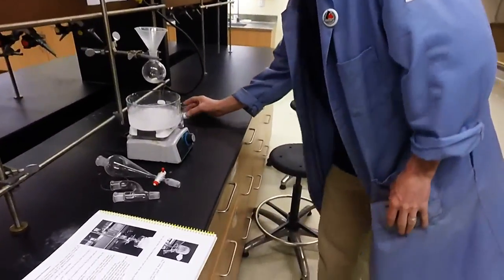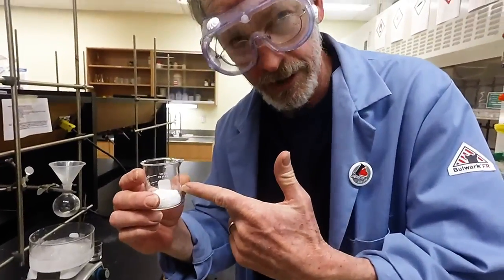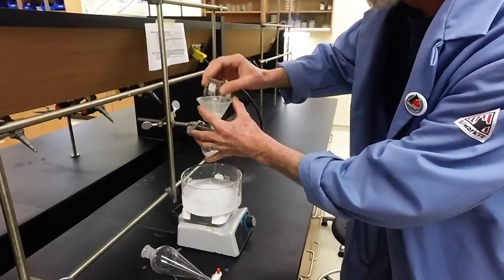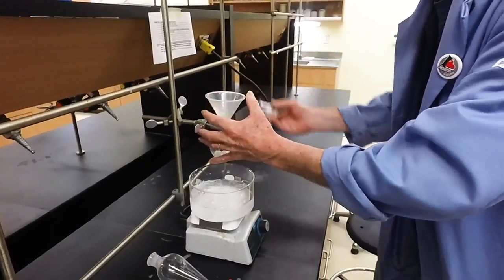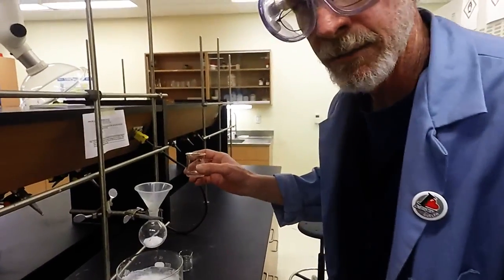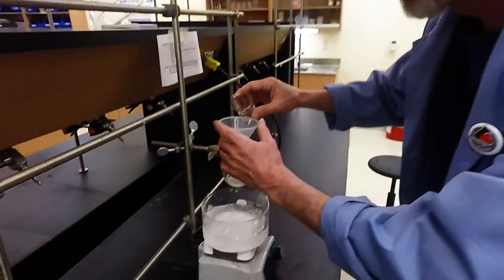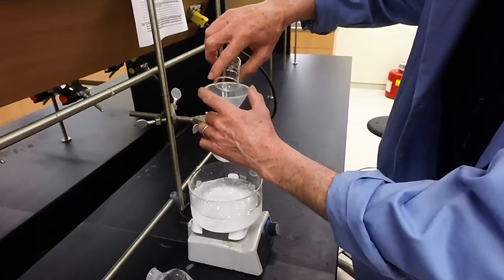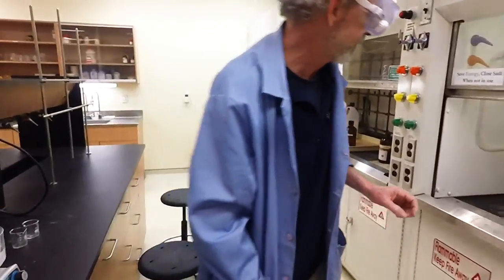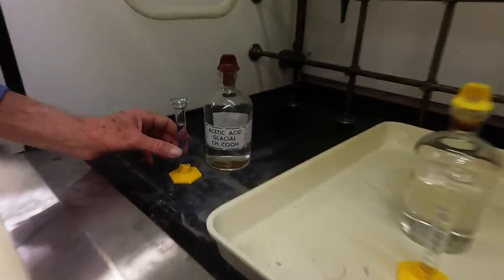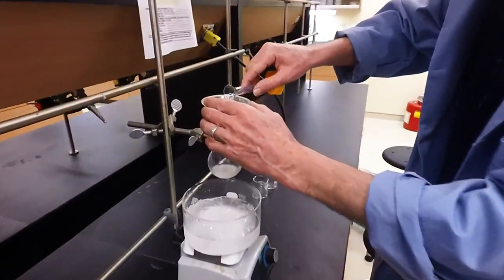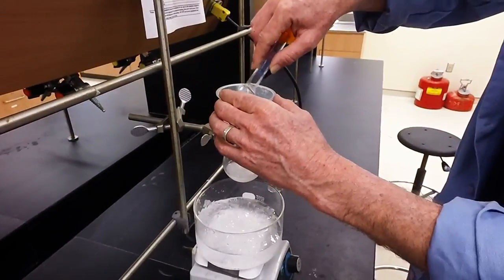So I have my 1,4-dimethoxybenzene weighed out here. Use a powder funnel, please. A little tap. In she goes. I have the alcohol, the 3-methyl-2-butanol, and that one goes. Weighed that out previously. So here we go. Our solvent for our reaction, glacial acetic acid, and that goes.